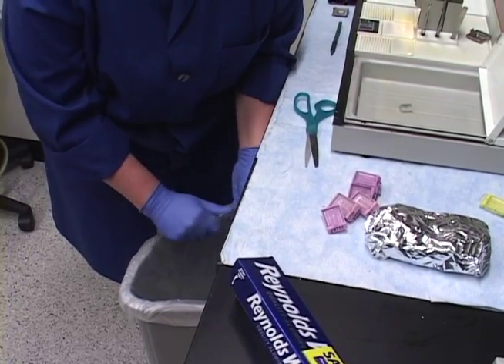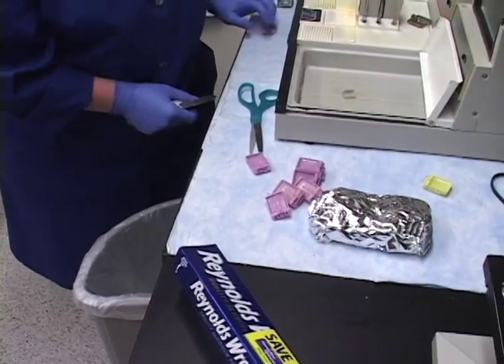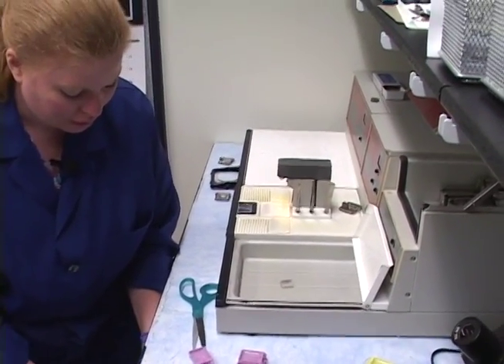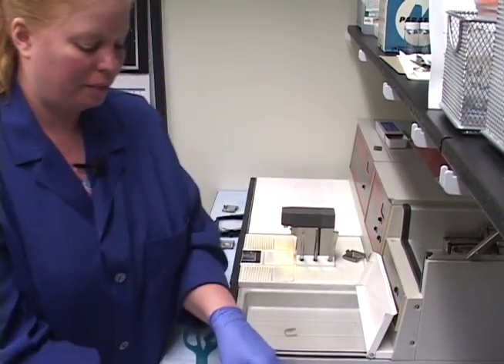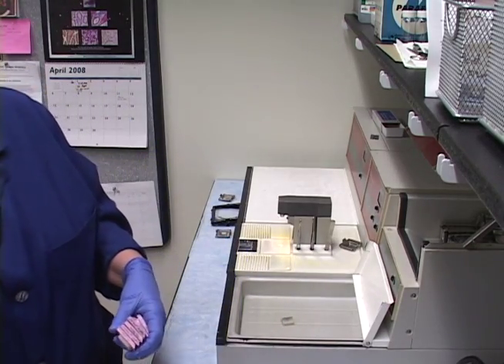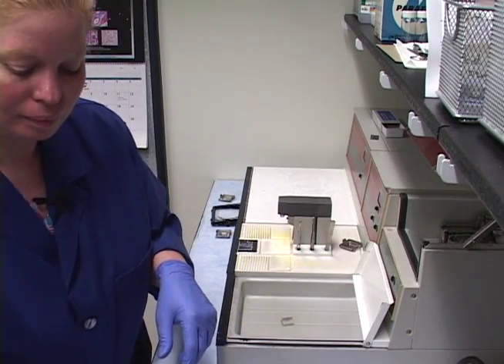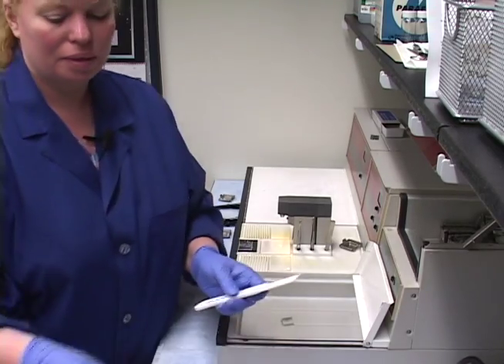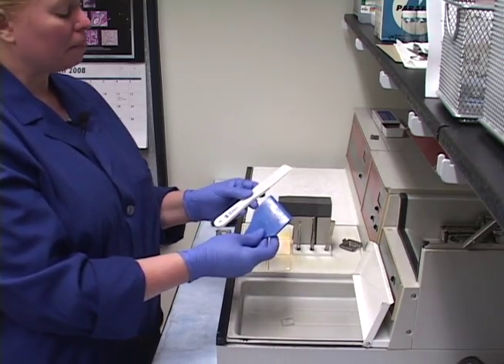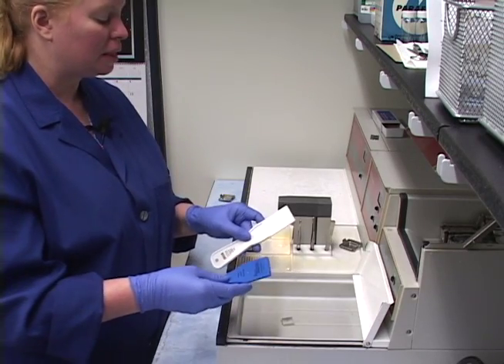Now we're going to do the cleanup of the embedding center. I can't stress enough how important keeping this clean is going to be. I have a couple of scrapers that I use - you can even use these for the floor. They're just little paint scrapers I bought from the store. You can get a real nice wide one for the floor; I have one that I keep by the processor.